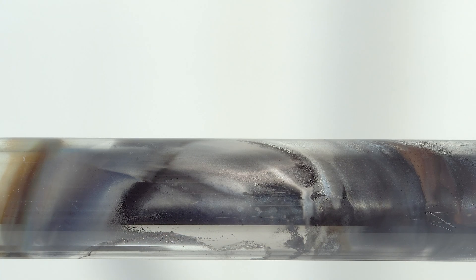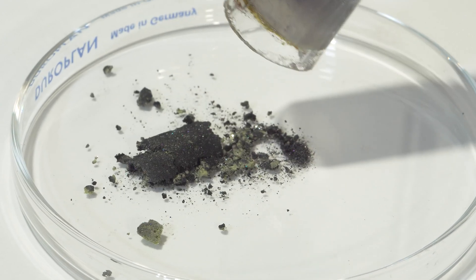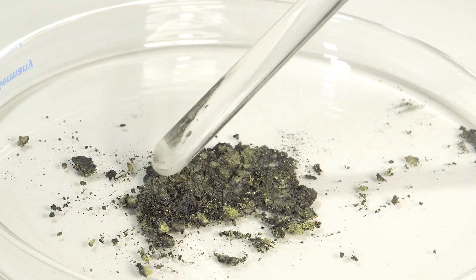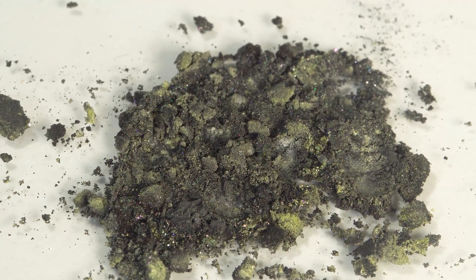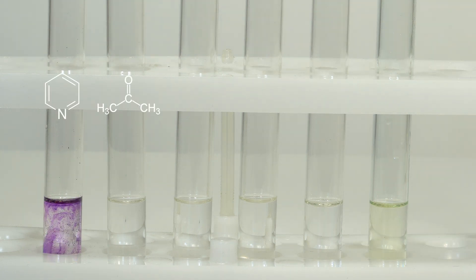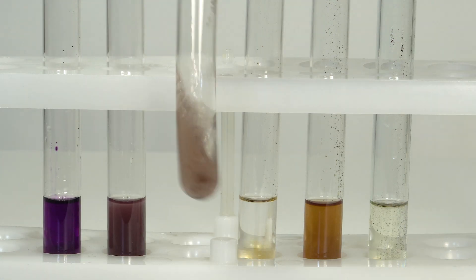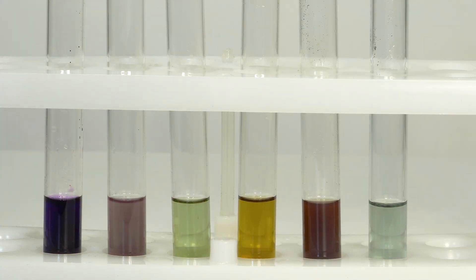Looking at the reaction products, we will see apple green vanadium dichloride among metallic vanadium and unreacted vanadium trichloride. Vanadium was so named because it forms compounds with beautiful colors, and these colors differ not only depending on the oxidation state of vanadium. When we add vanadium trichloride to different organic solvents, we also get different colors. For example, I took six different solvents — pyridine, acetone, methanol, ethanol, tetrahydrofuran, and allyl alcohol. With each of these solvents, vanadium trichloride forms an adduct of a certain color. In general, in chemistry, it's vanadium compounds that have the widest range of colors.